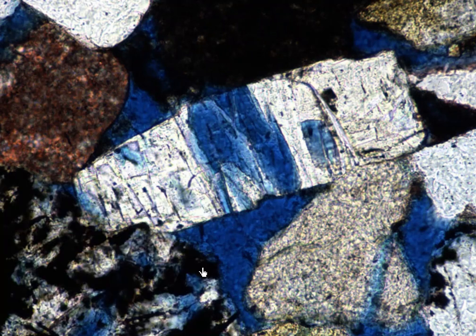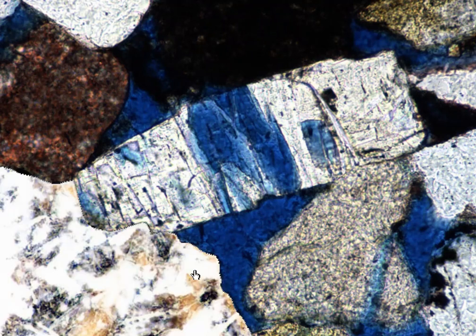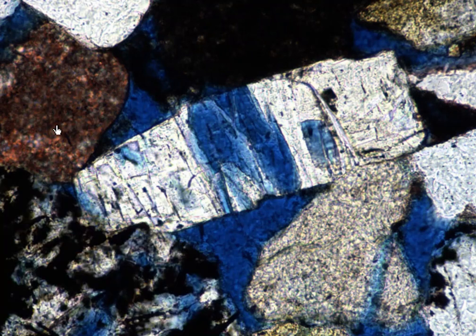This is a volcanic rock fragment. It may be difficult for us to tell, especially because it's altered, okay? But it did highlight, there's the grain of the fragment, and we have multiple mineral patches in that fragment. Let's see what this is. Another volcanic rock fragment.